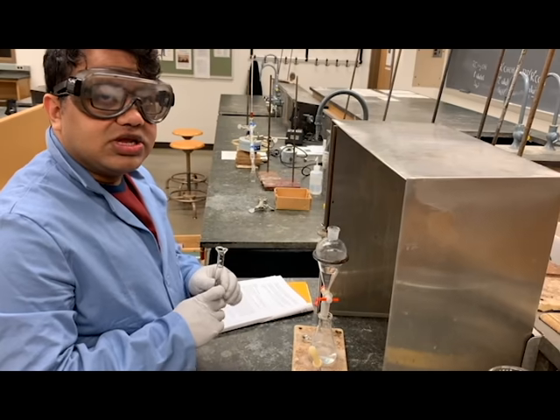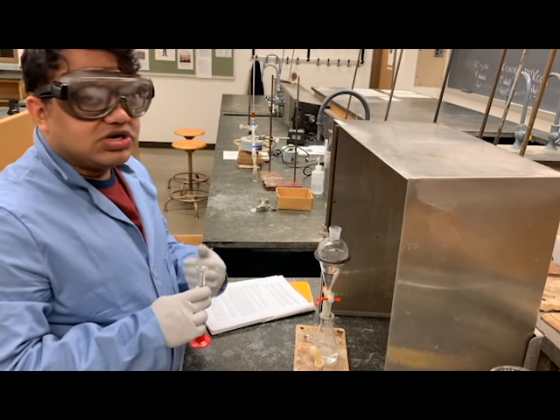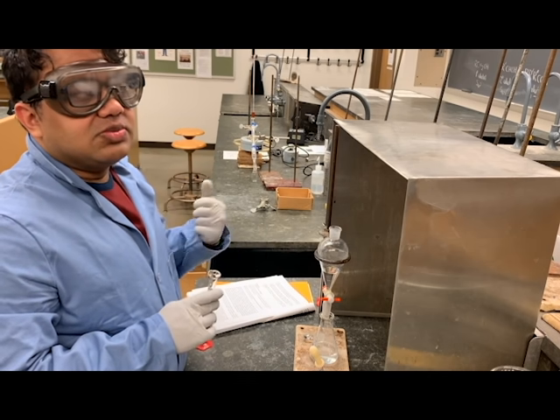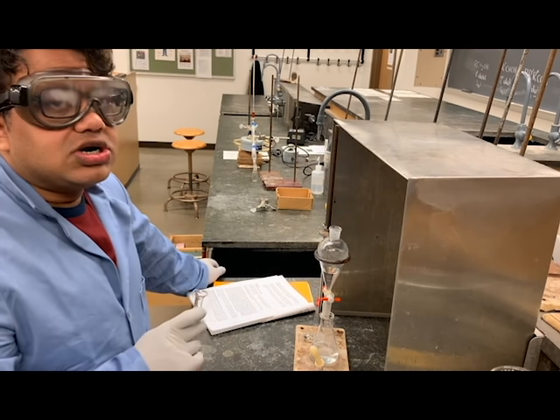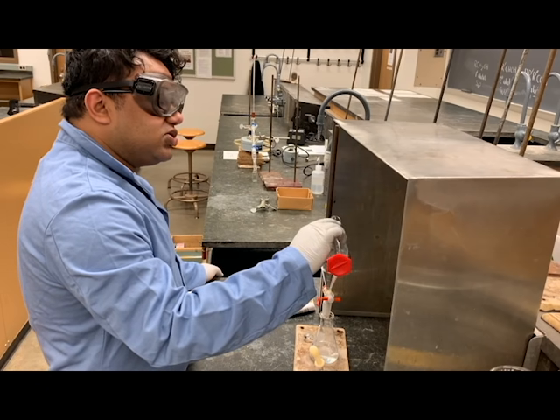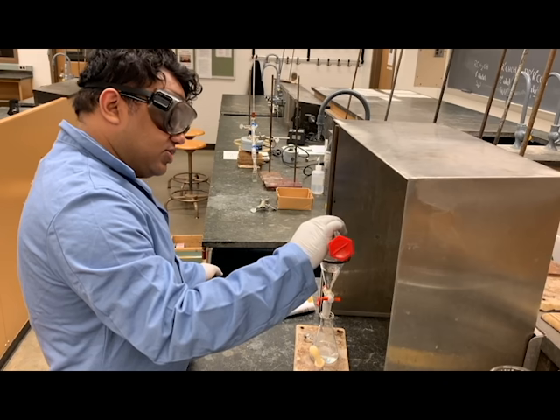Sodium bicarbonate is a base and you have hydrochloric acid in the media. So if there is any remaining hydrochloric acid left, bubbles of carbon dioxide are going to be produced. So if you close your stopper onto the separatory funnel, make sure you vent it very often to let the carbon dioxide escape.